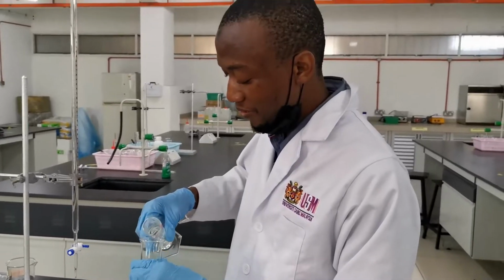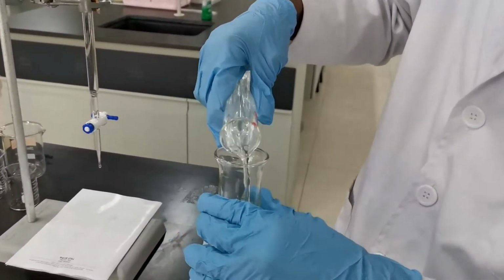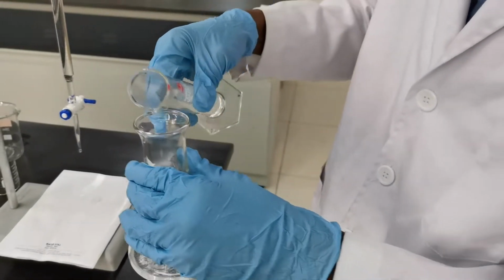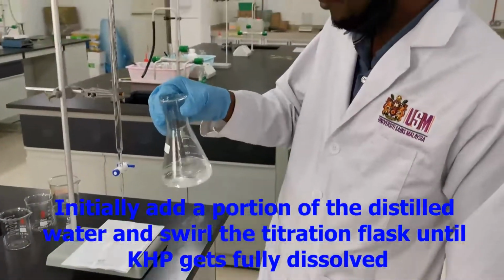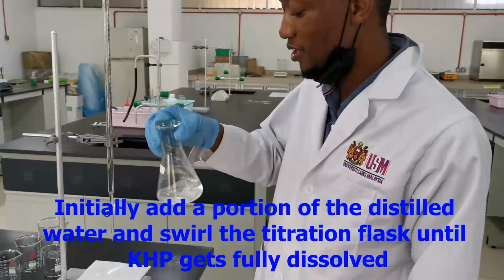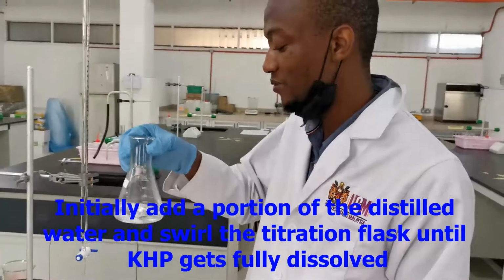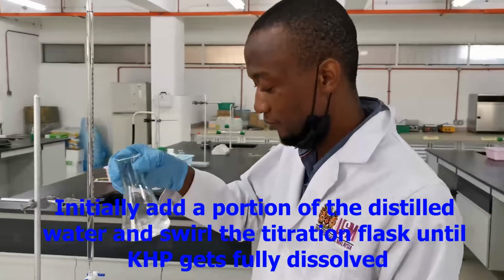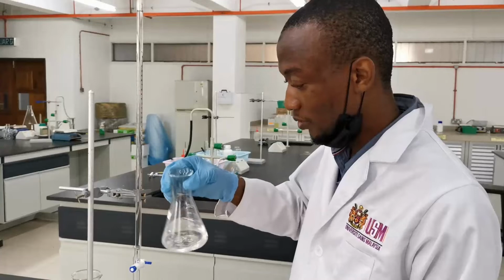You can see how I'm adding gently. You don't add everything at once. Add a little and swirl continuously. Ensure that every particle dissolves.